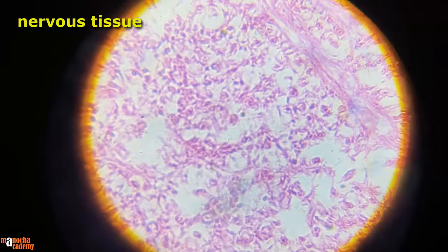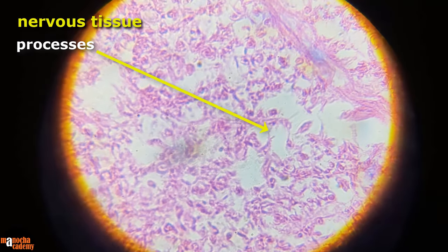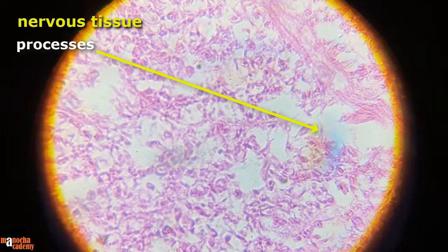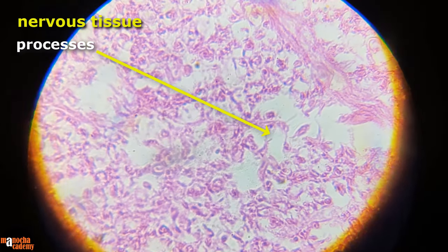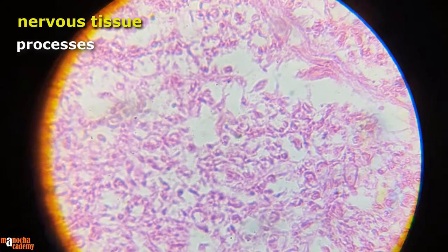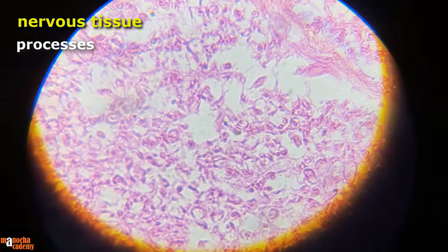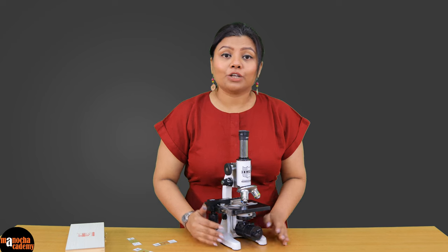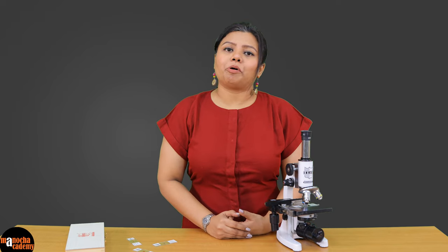This is how it looks under the microscope. You can see the processes clearly. Although you might not be able to distinguish all the different layers covering the axon, you can definitely make out that there are processes coming out from the nerve cells. So those were the tissues we observed today under the microscope with the help of prepared permanent slides.